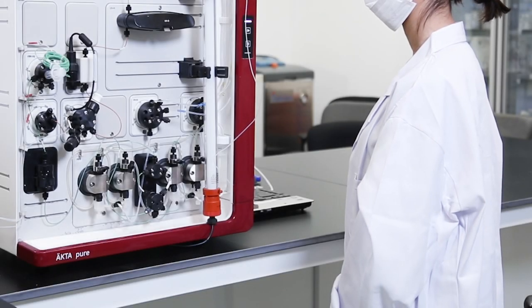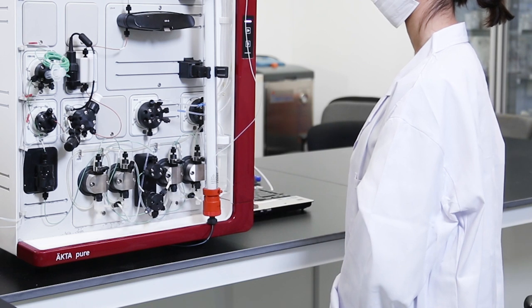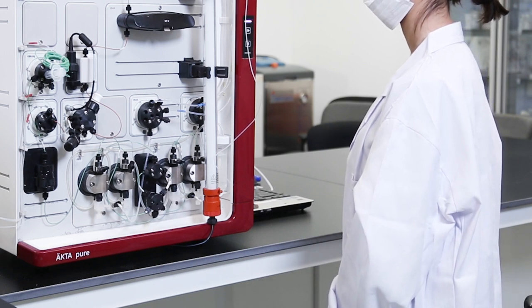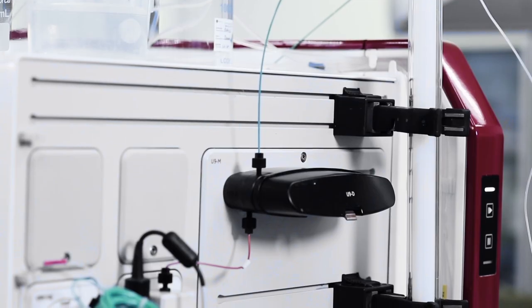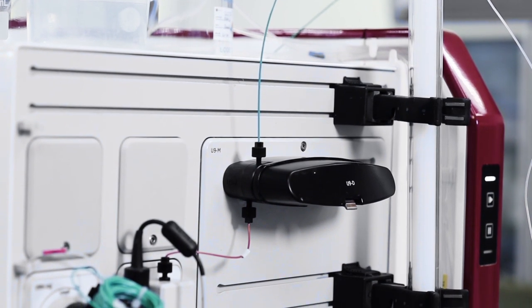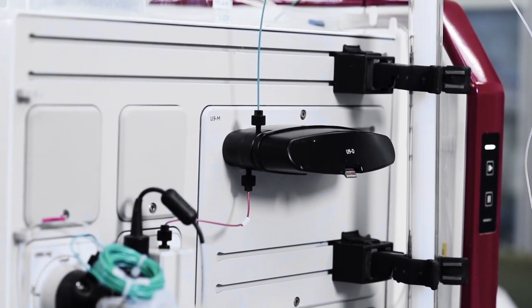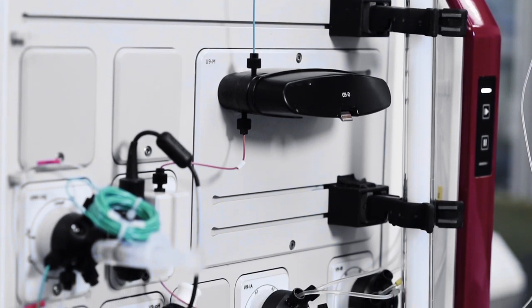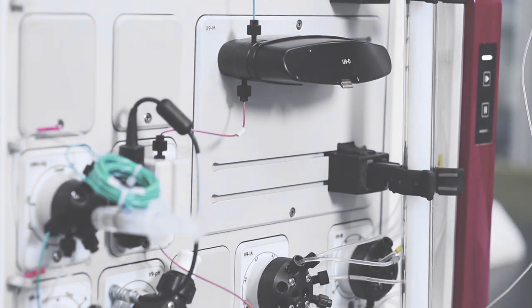Every column should be tested for packing quality. A performance test can evaluate the performance of the packed column. It is an excellent tool to check and document the quality of a column over its lifetime. It is also an effective diagnostic tool when performance problems occur.